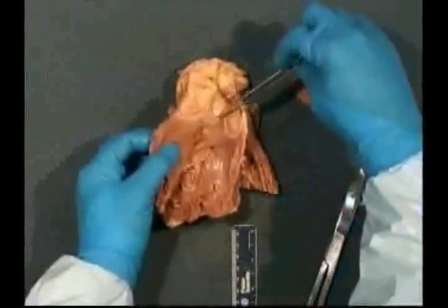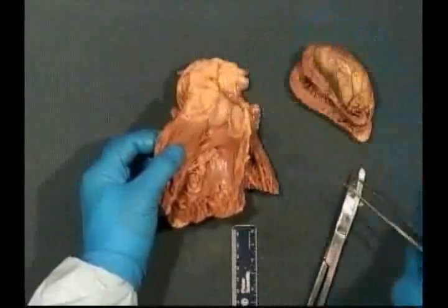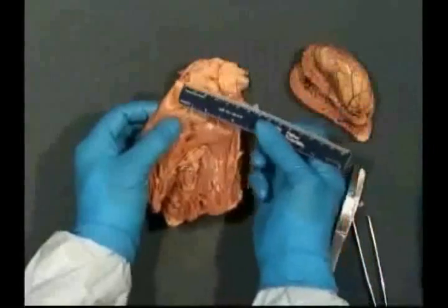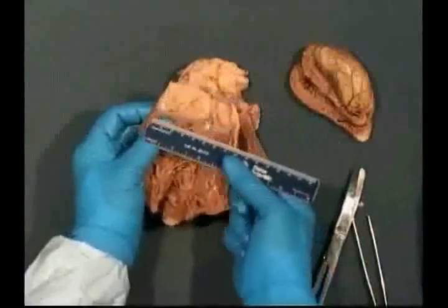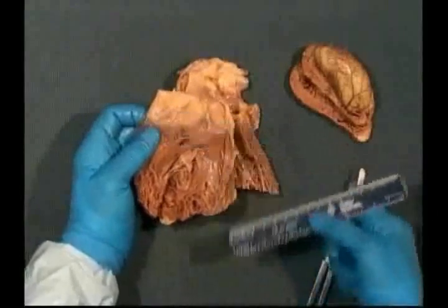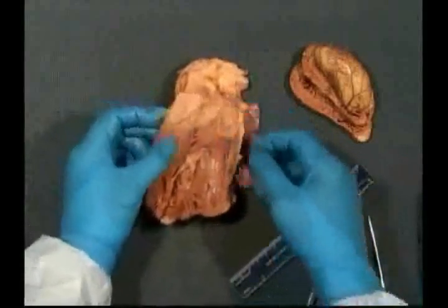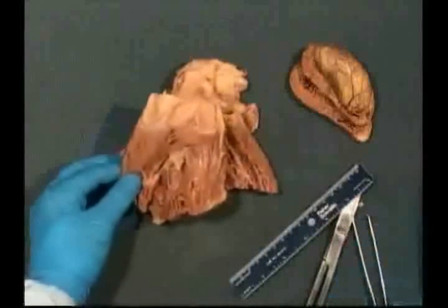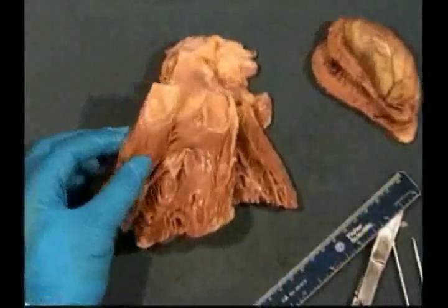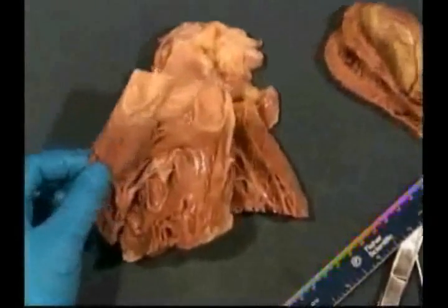The pulmonary valve circumference in this case is going to be measured next. It's about 7.5 centimeters. We do know the patient probably had mitral regurgitation. The patient may have developed some pulmonary hypertension that would explain the thickened right ventricle. Next we go to the left side of the heart. Again, we already said we thought the left atrium was dilated.